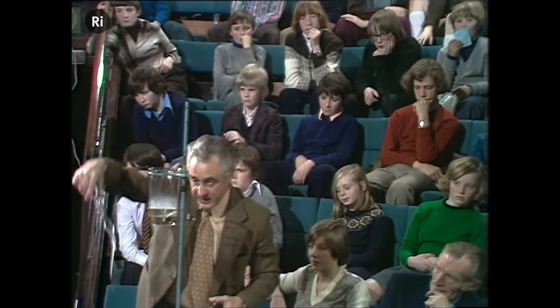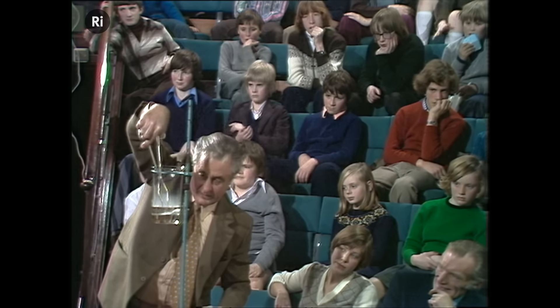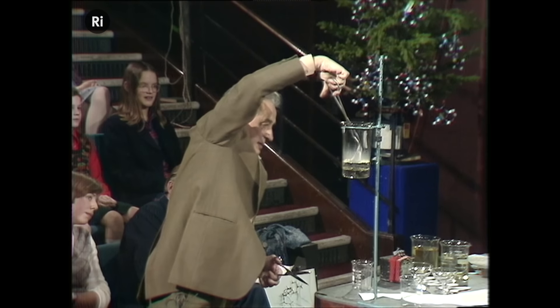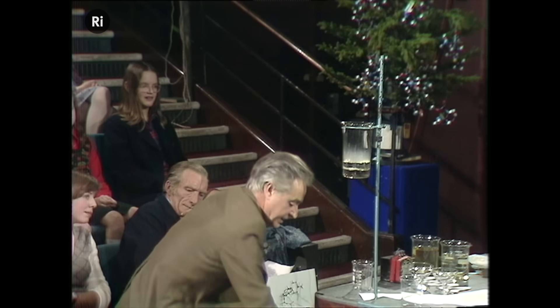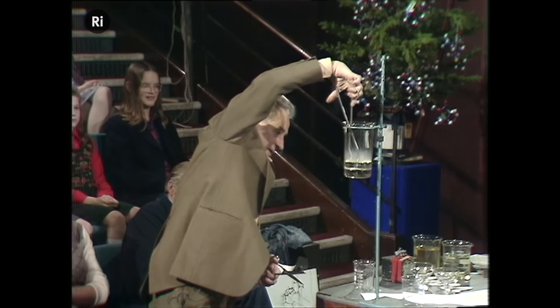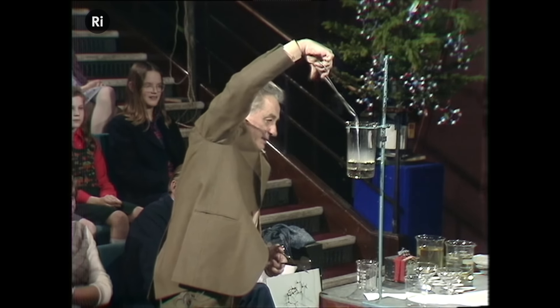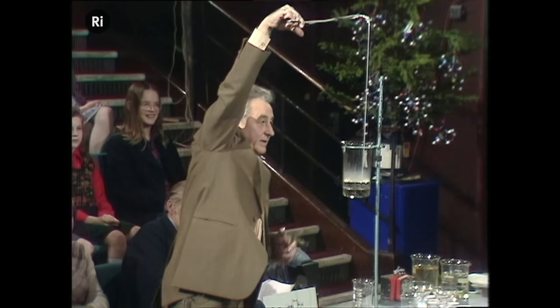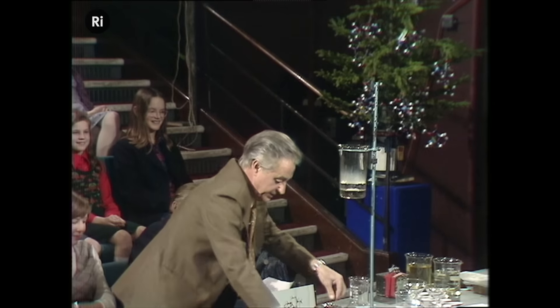Now, very shortly, with a bit of luck, if I can get it from the wall, we shall get a thread of nylon. The nylon tends to stick to the wall a little bit. There we go. Thread of nylon. And we can spin some more nylon.